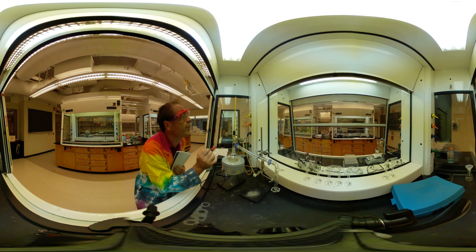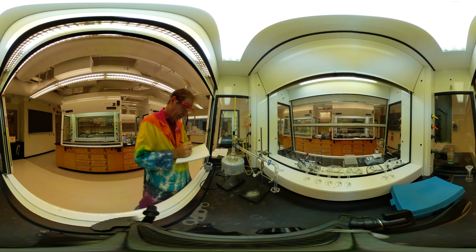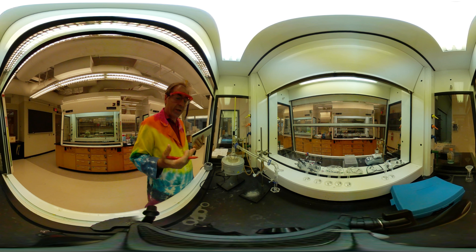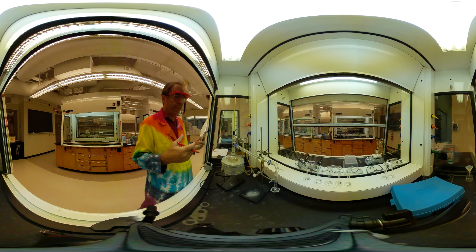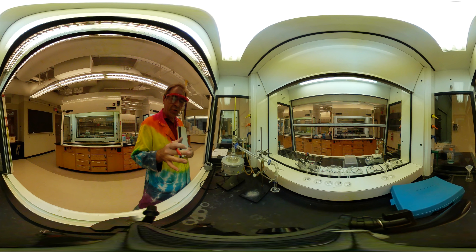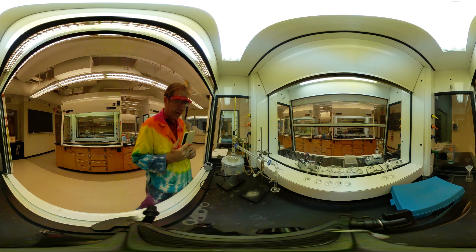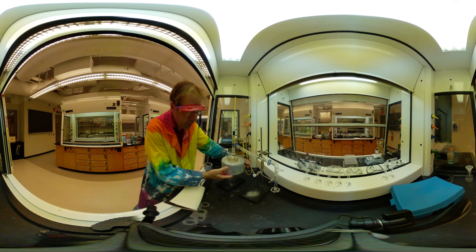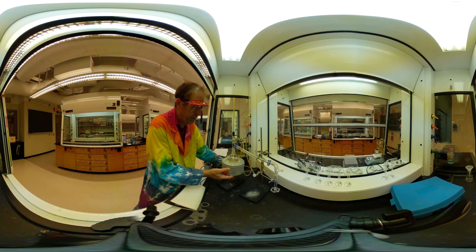First drip — I'm going to take my temperature there. Once again, we're going to continue to collect temperature and volume data about every two milliliters approximately, and then we're going to collect the density of several fractions. This is coming through a little bit quick again — this happens — so I'm going to slow this down a little bit.